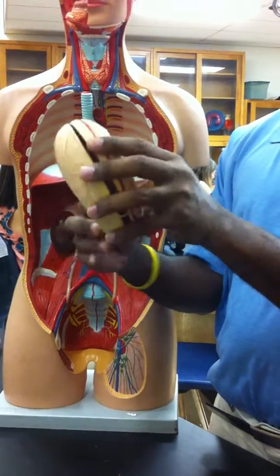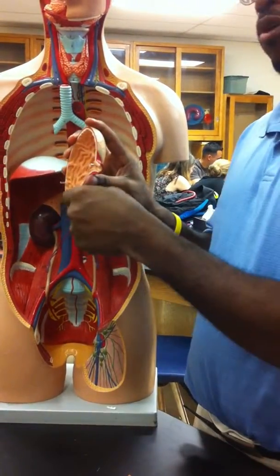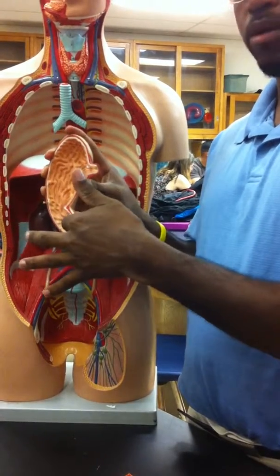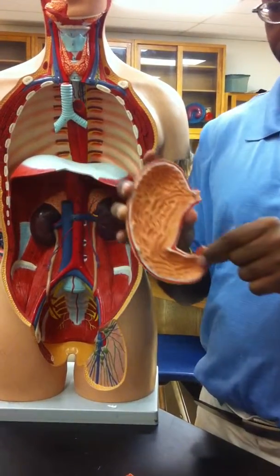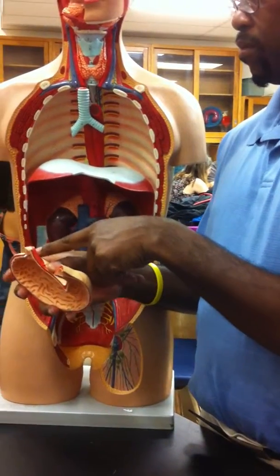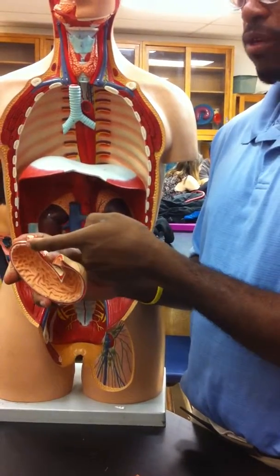If I look inside, the sphincter is the pyloric sphincter — this is the pylori, this is the pyloric sphincter. And up at the esophagus, there is the esophageal sphincter — the lower esophageal sphincter.